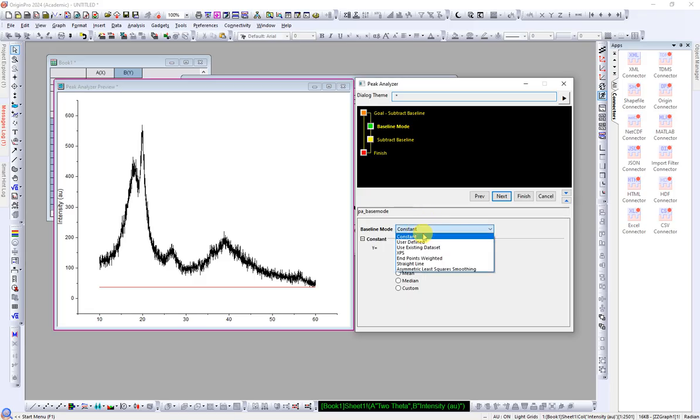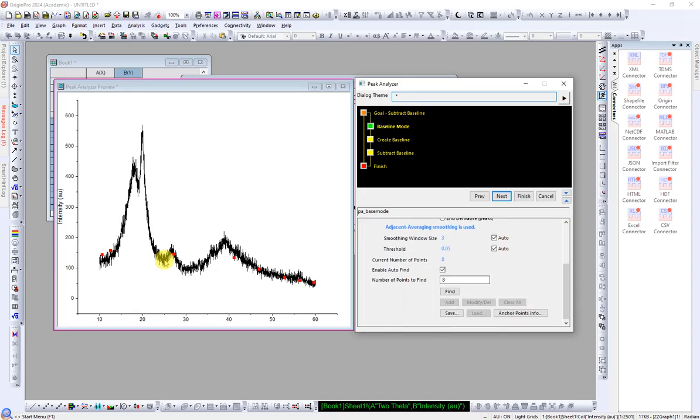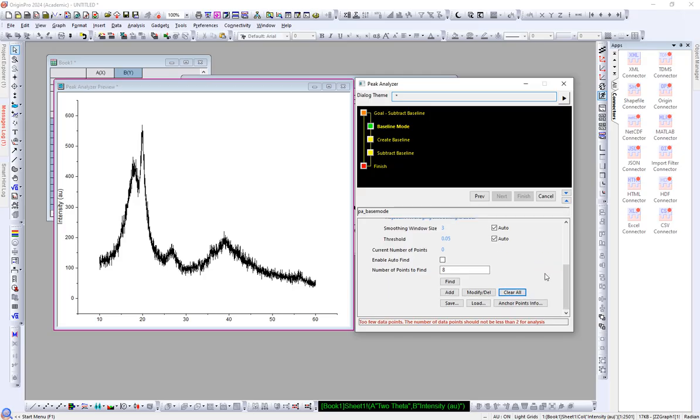So instead of constant we will use User Defined. We will define it by ourselves. It has automatically chosen some points, shown here in red, to correct the baseline, but we will add the points where we want. The auto find is not very correct. It should not be here, it can be here only. So let's uncheck this. And if you don't like these points, you can remove them and add your own points. Just clear all. Yes, now we will add our own points.